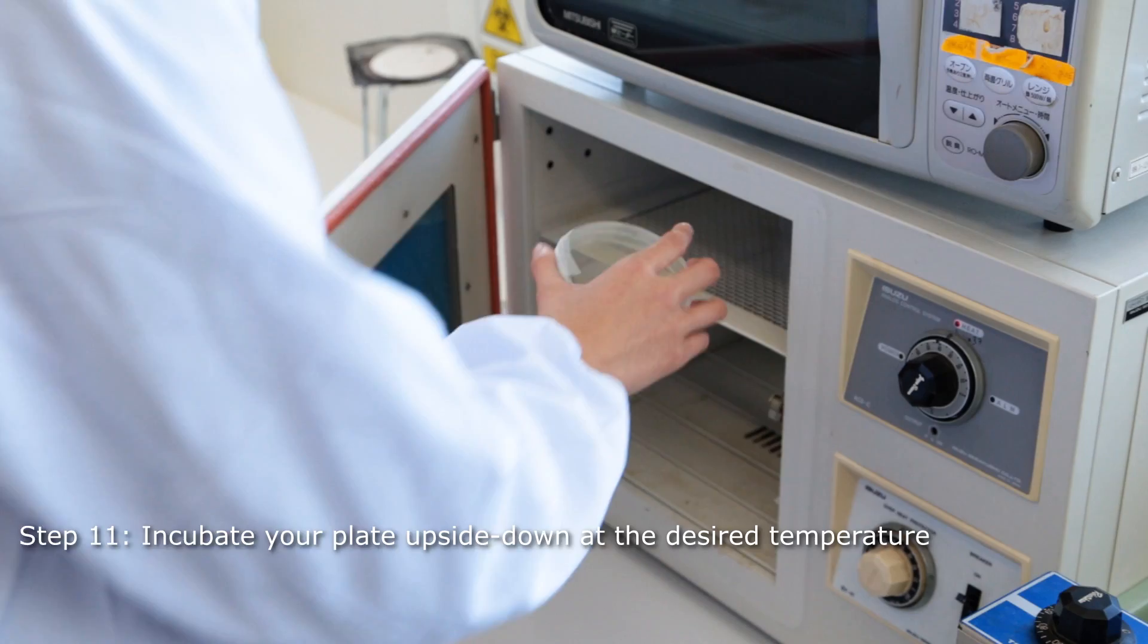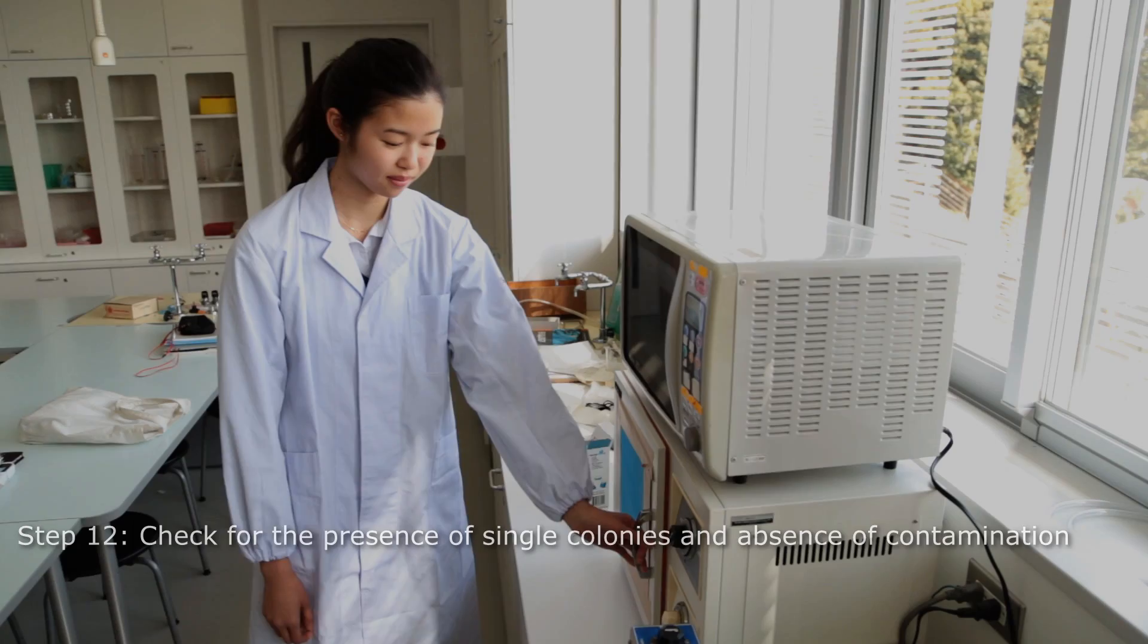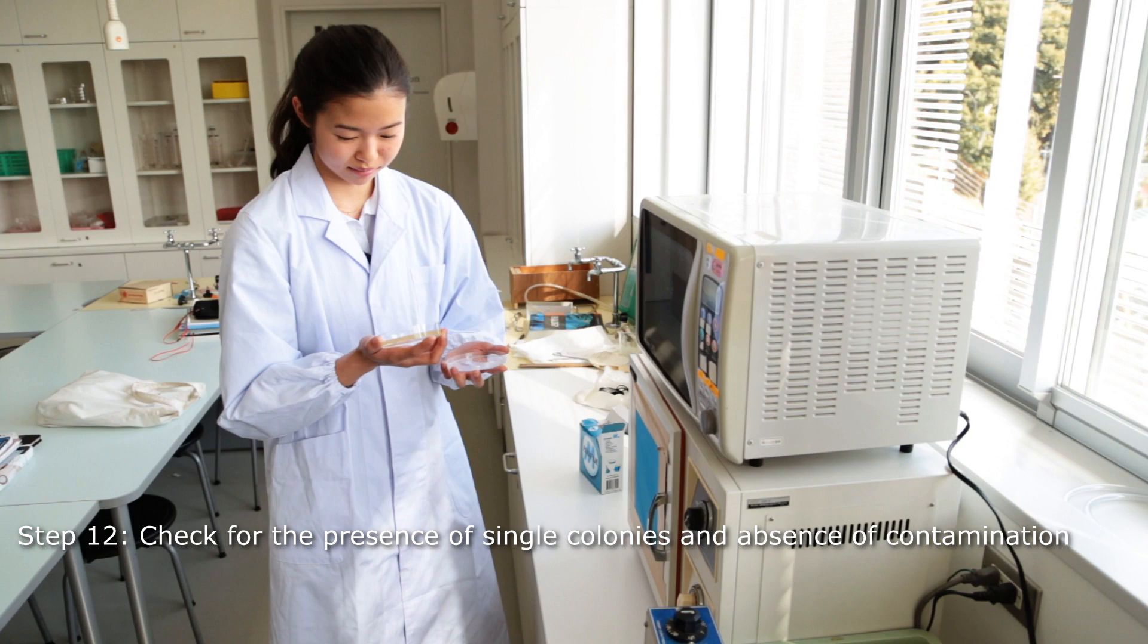Incubate your plate upside down overnight. Pick up your plates on the next morning and look for single colonies. This is an overnight culture of Escherichia coli.